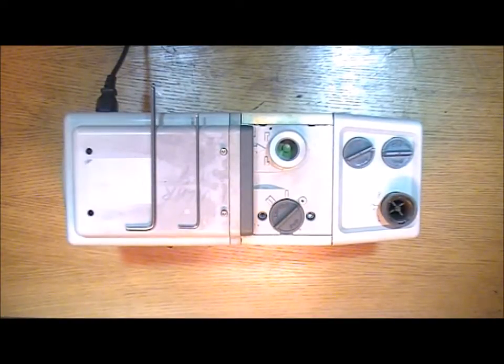Today I'm going to show you how to change the outer shaft seal on an Edwards RV vacuum pump.